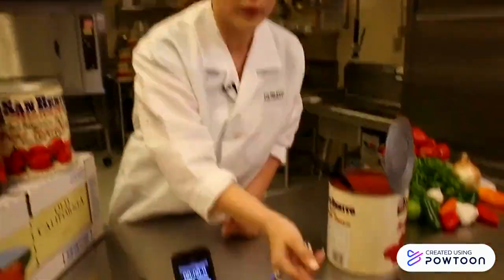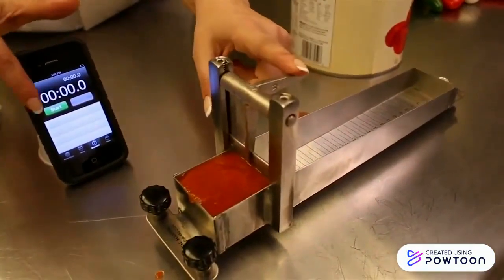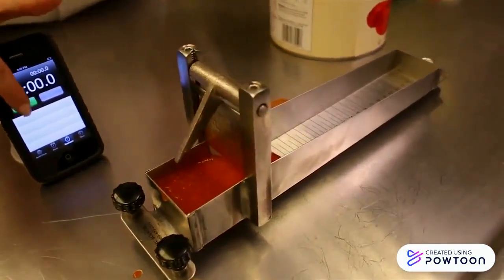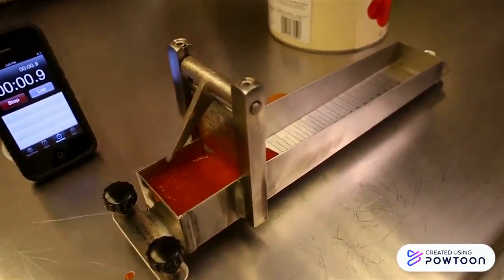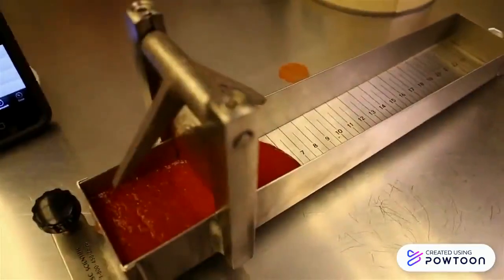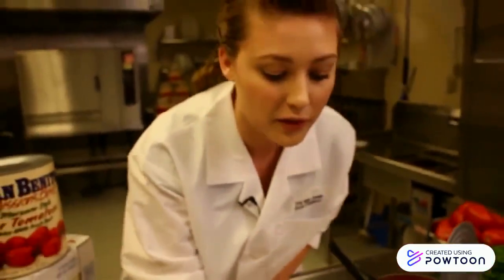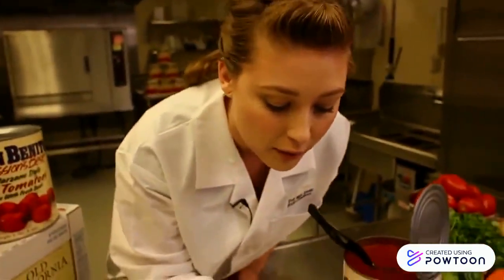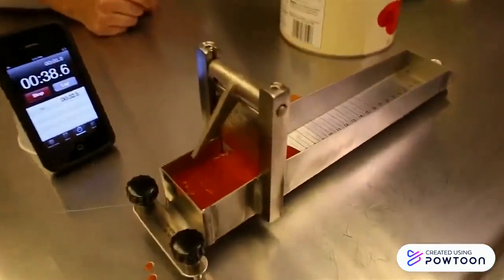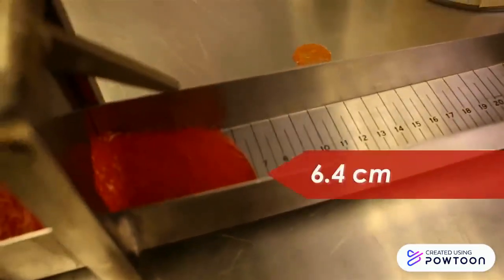Next, you release the product at the same time that you start a 30-second clock. Go ahead and stop the clock and observe how far the product has traveled down the trough. For us, we've got about a 6.4.